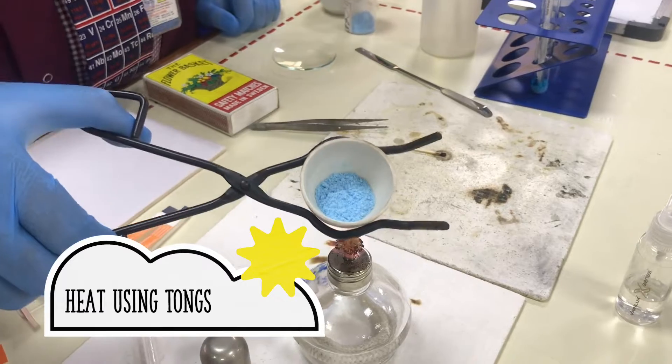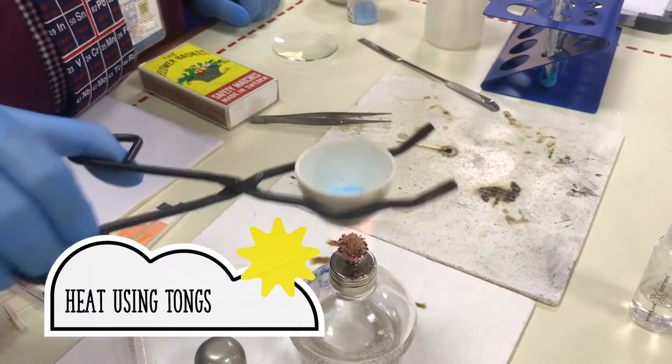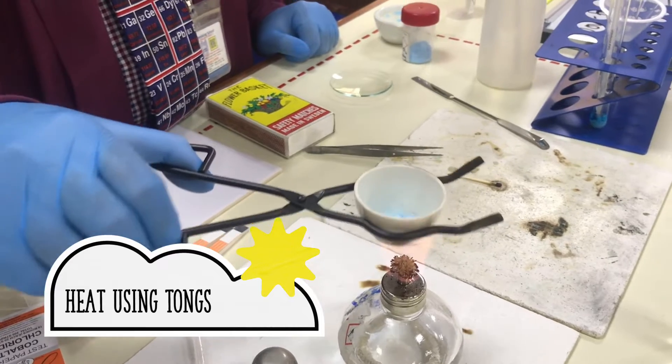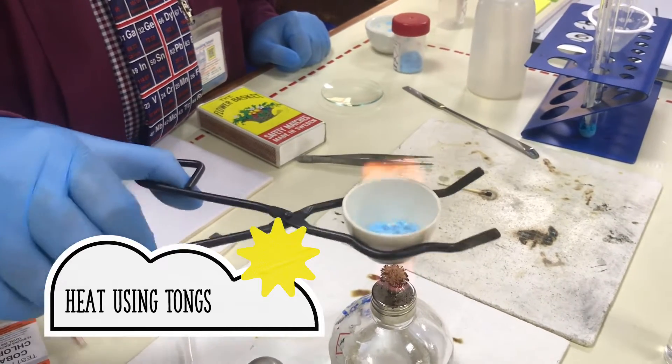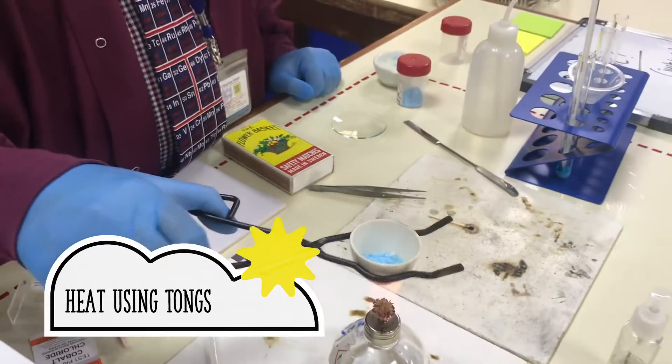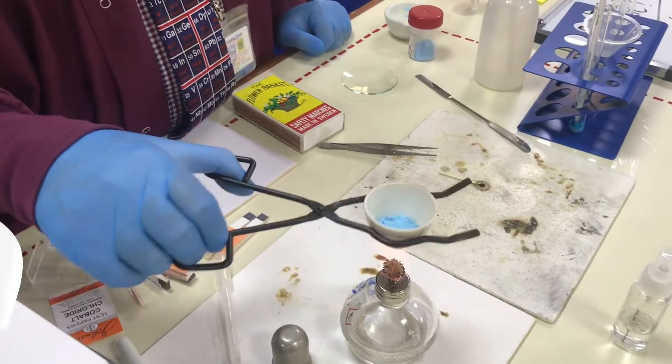What I'll do is I'll just show it to you so you can see what's going to happen. So heating it is actually going to allow us to get rid of what's called the water of crystallization.